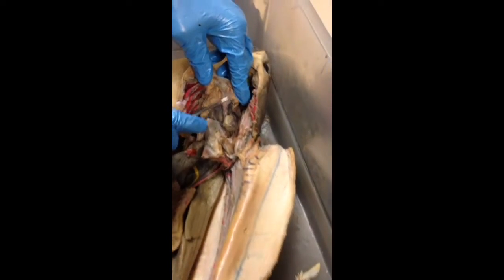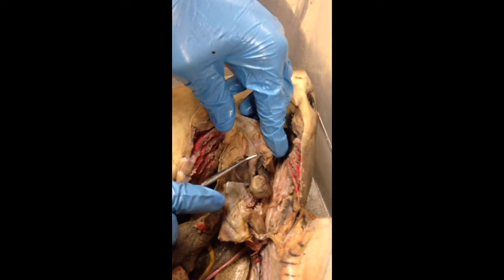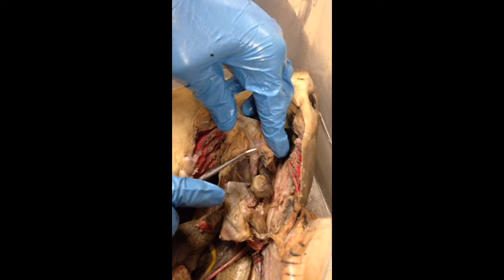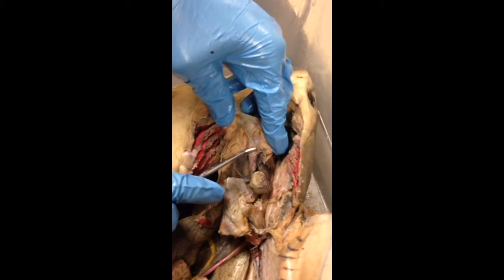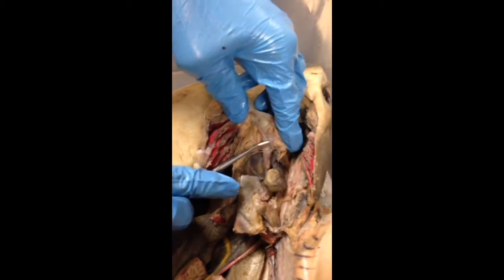Next one is the ventral aorta, and it connects the conus arteriosus to the afferent branchial artery. It's just a very small section of tissue there.